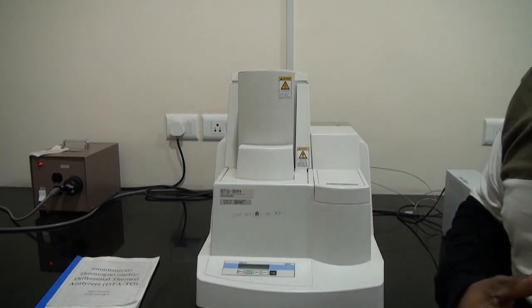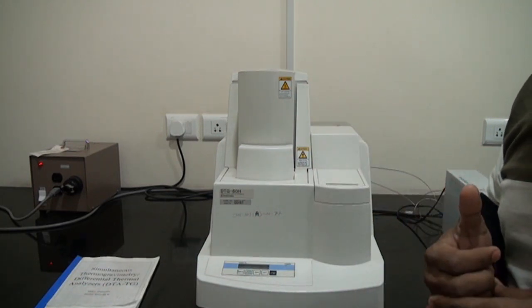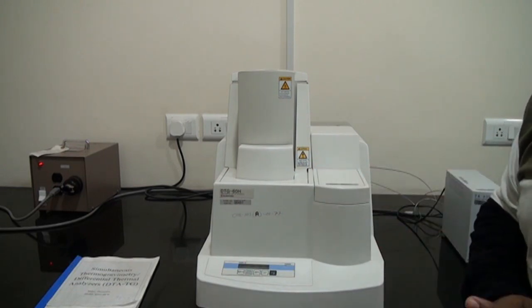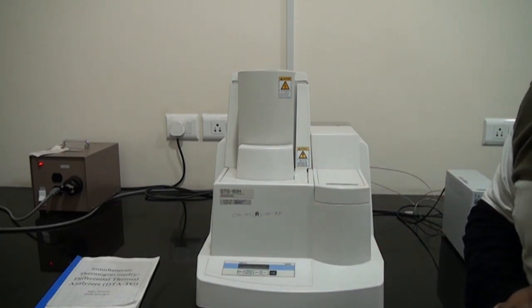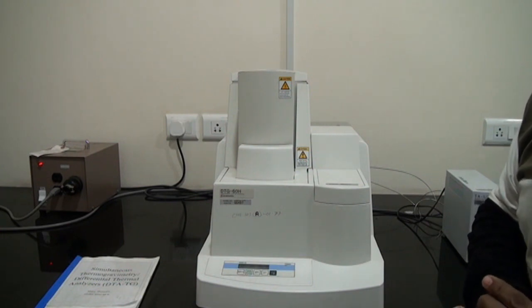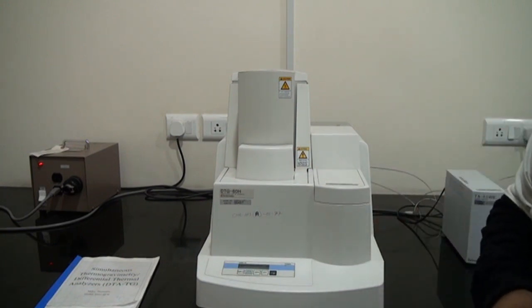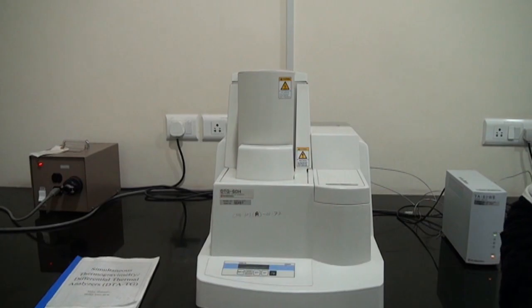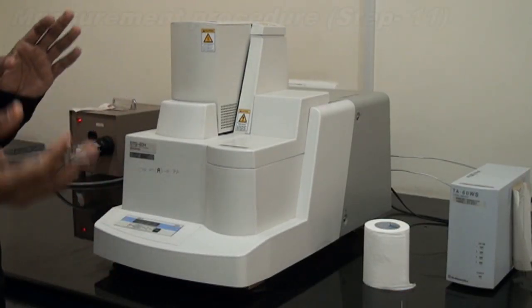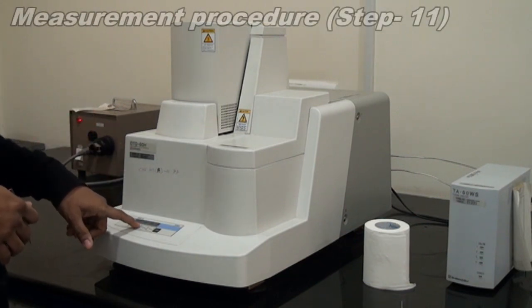Once you are done with measuring the parameters, you go to the next step, the data collection procedure. Right now we need to wait for 1 hour 17 minutes plus the cooling time of the furnace until it reaches 30 degrees centigrade. After it cools from 800 degrees to your room temperature, 30 degrees centigrade, you click the open button.